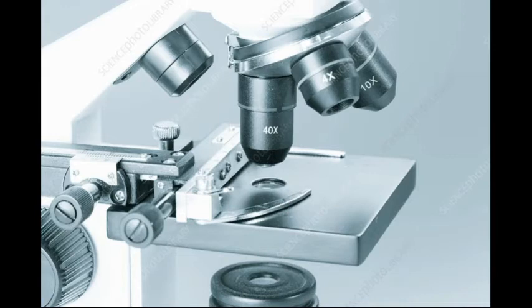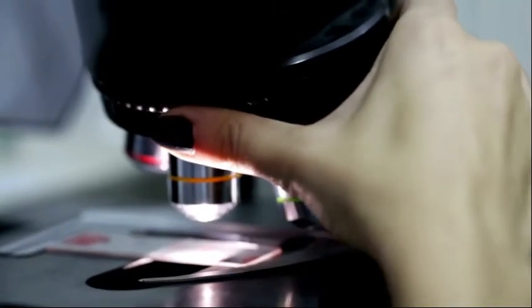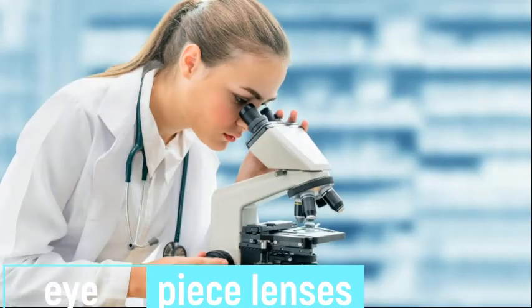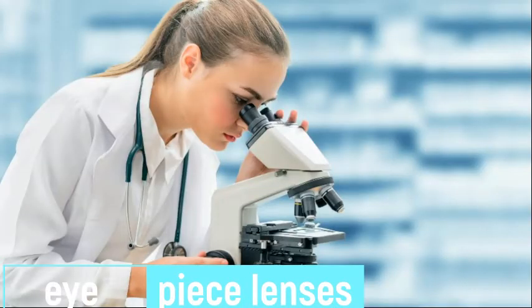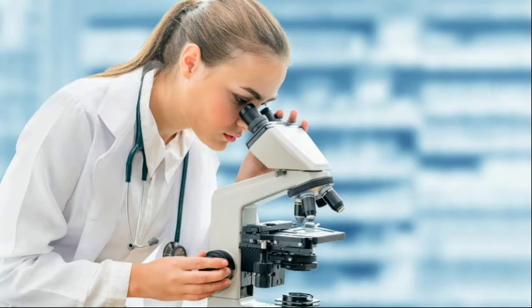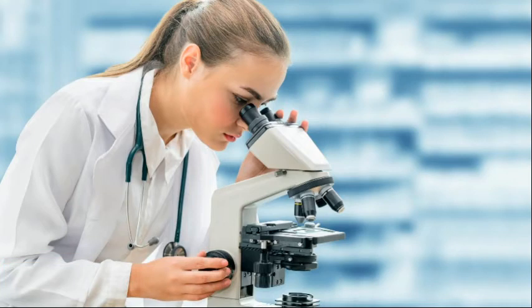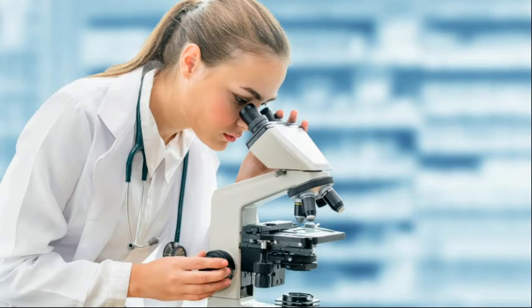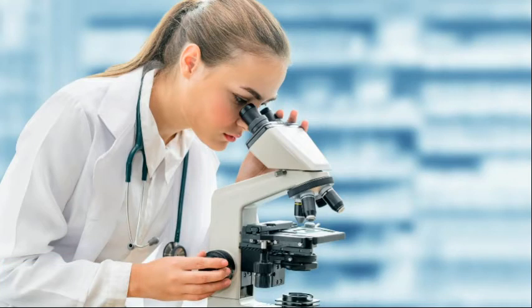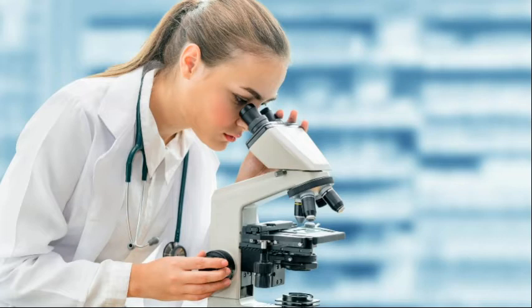The eyepiece lenses represent the part where the observer places their eyes when viewing the object through the microscope. This is the opening through which you look to see what is happening on the slide.